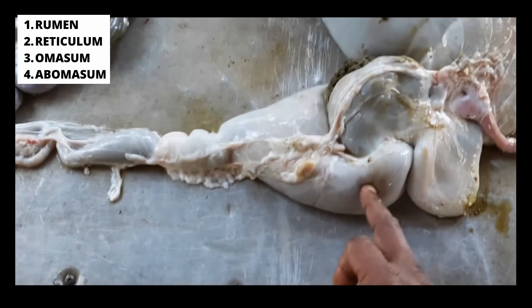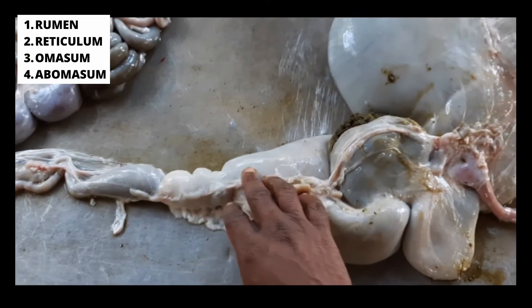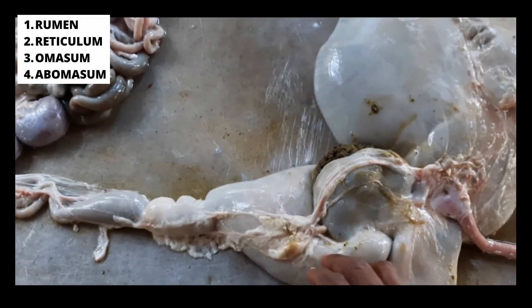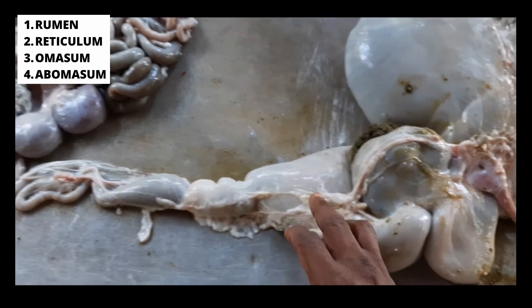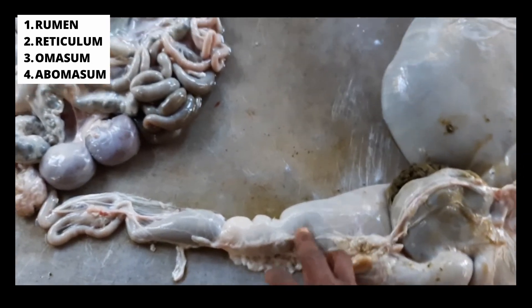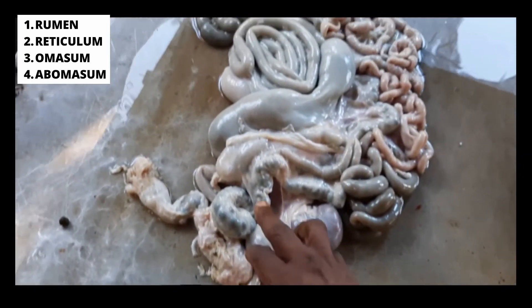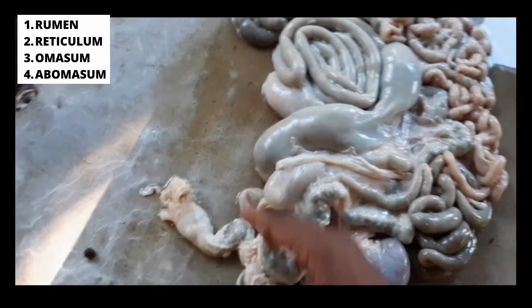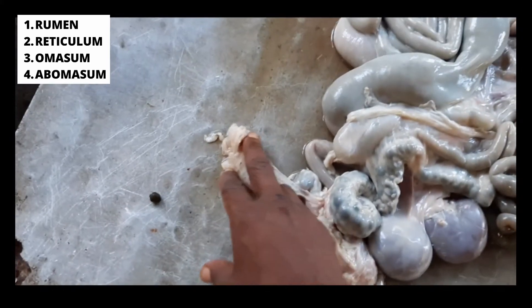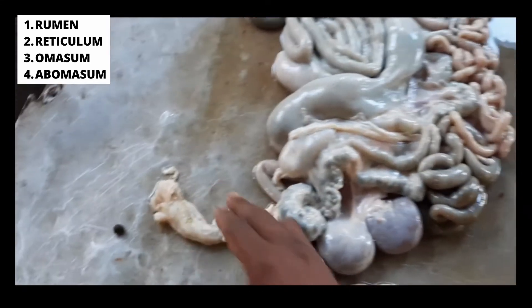And then from here down is the abomasum, which is referred to as the true stomach. And then from here you have the large intestine, and this is the part that will lead to the anus.